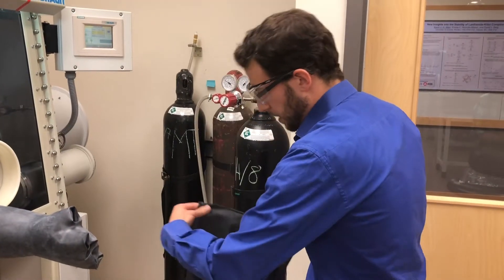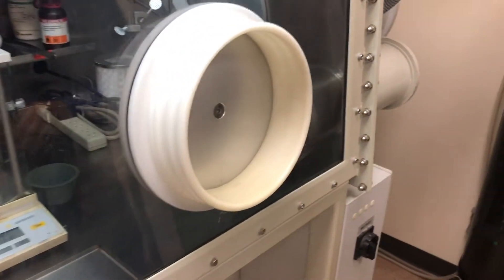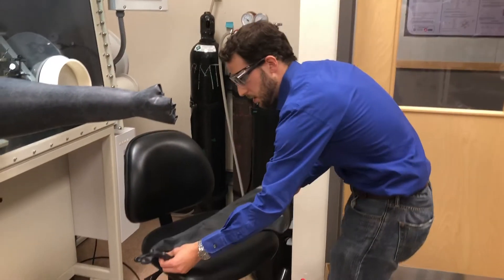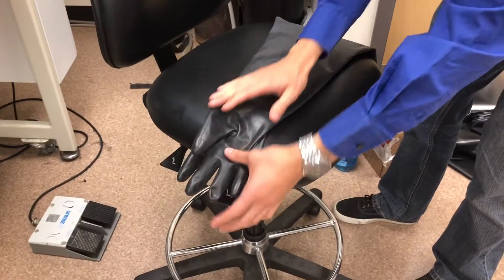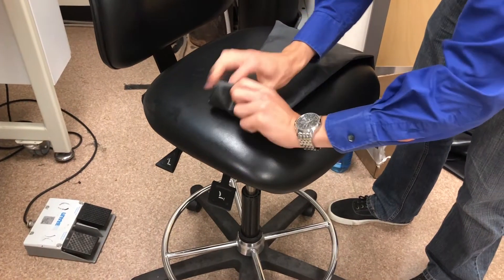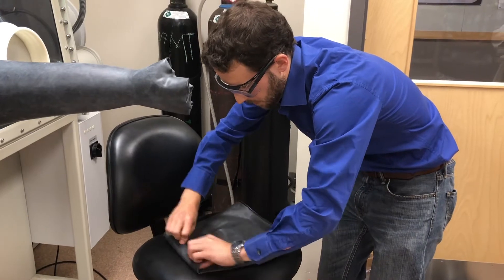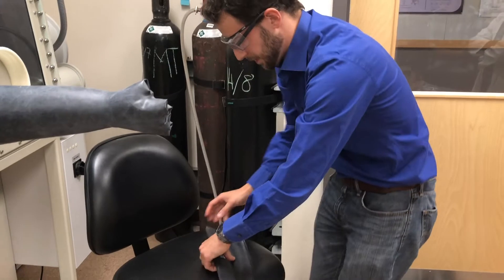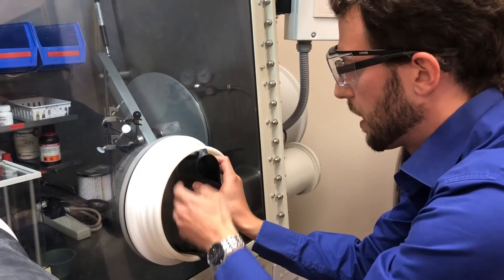And when we want to attach this there will be some air going in. But we want to keep the air to a minimum. And for that we'll just roll up the whole glove. You just need to keep in mind which part is up and which is down. Roll tight. Press some of the air out. And then stick it in so that up is still up.